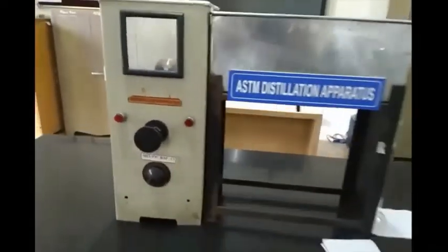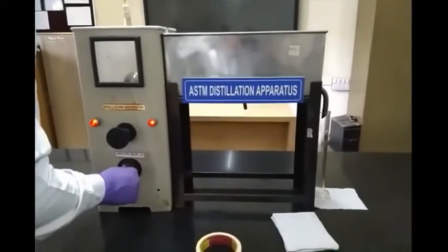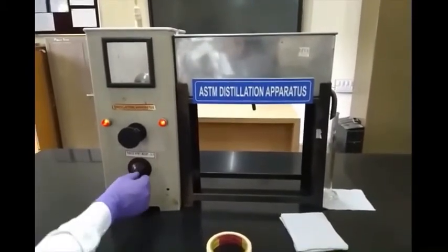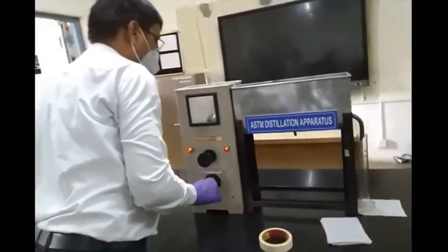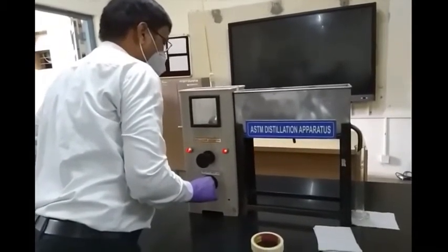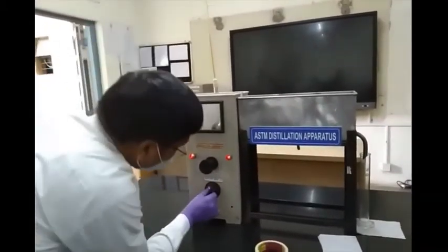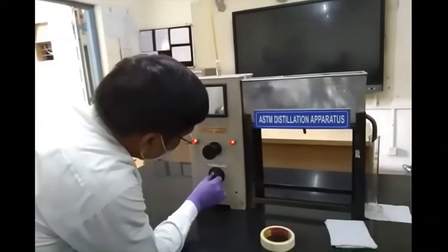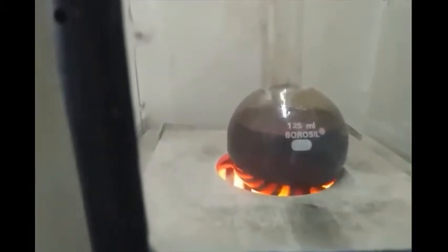Now that our apparatus is ready, we start the heater. Then we adjust the power regulator such that the liquid is heated in a controlled manner. There is a possibility that the liquid might erupt suddenly because of volatility, so adjusting the regulator is of utmost importance. Slowly, the liquid starts to boil.